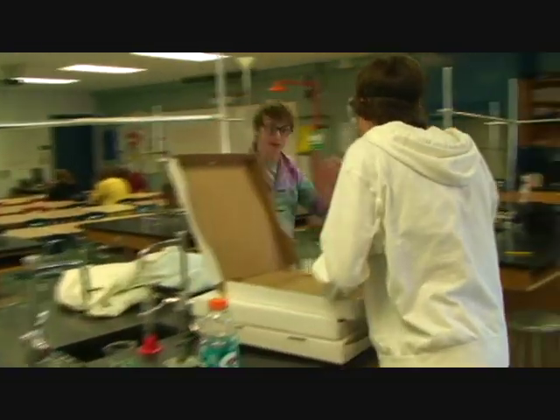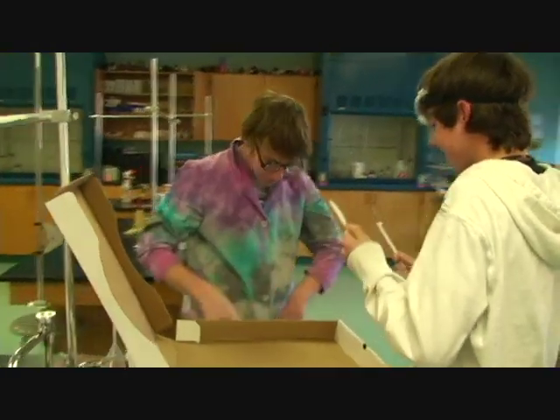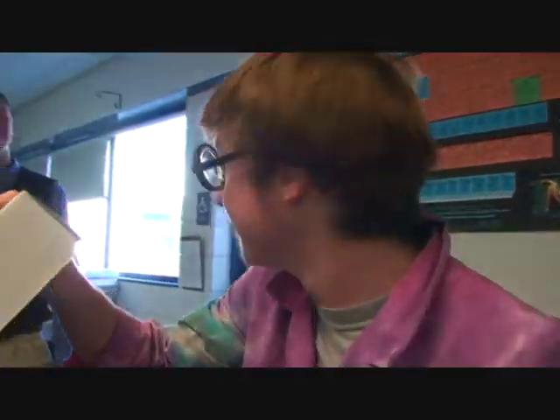Ralph, are you eating again in my laboratory? Ralph, there is no eating in the lab. There are chemicals all over this table and you're eating them. I love pizza more than anything in the entire world! But pizza is not allowed in the lab.